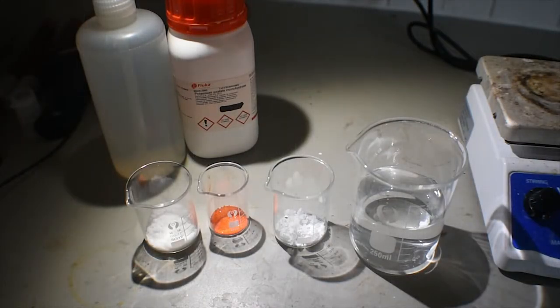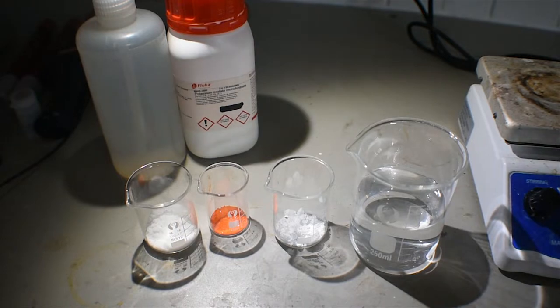Hello everyone, and welcome back to another video. Today's video is going to be an episode of Colorful Complexes, a series I started a while back looking at some very interesting and beautifully colored complexes of different metals.